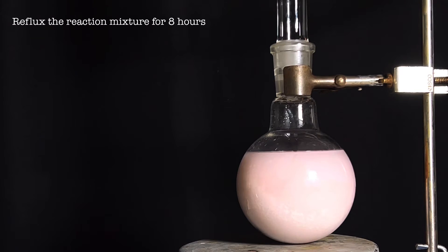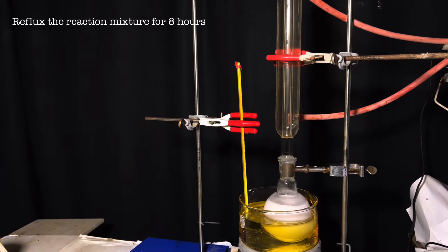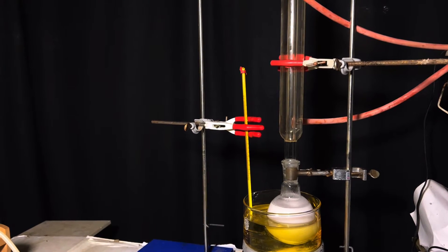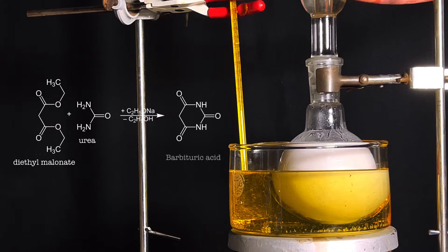Next, I had to reflux the solution for 8 hours. So I set up an oil bath and immersed the flask equipped with condenser into it. This is the reaction that is taking place.